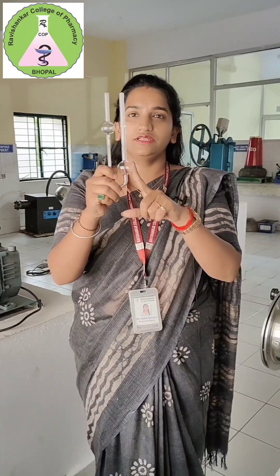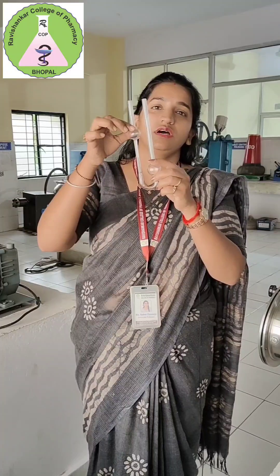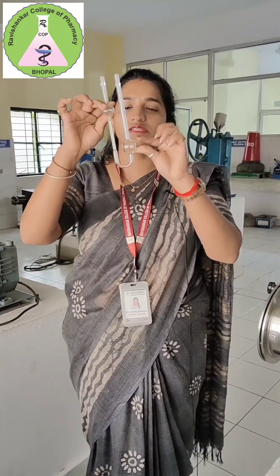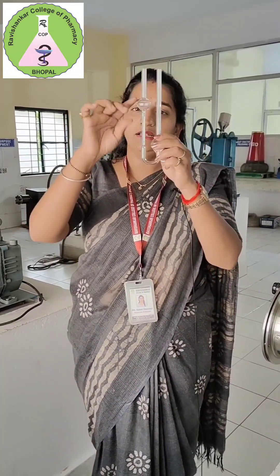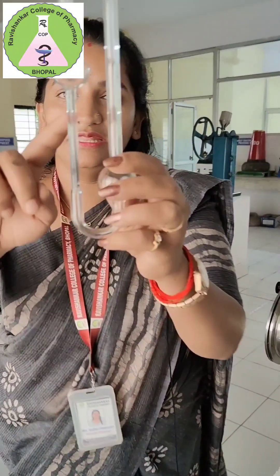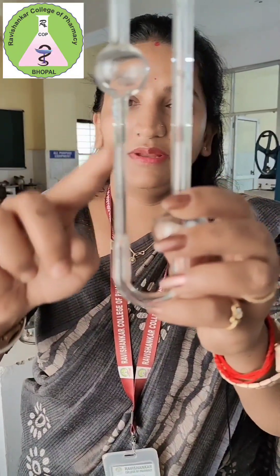In this viscometer, a known liquid that is to be determined — we fill it in the lower bulb. Then we suck the liquid up to the upper bulb. This is known as the upper bulb and this is known as the lower bulb. The capillary which is present in this area — this is the capillary.